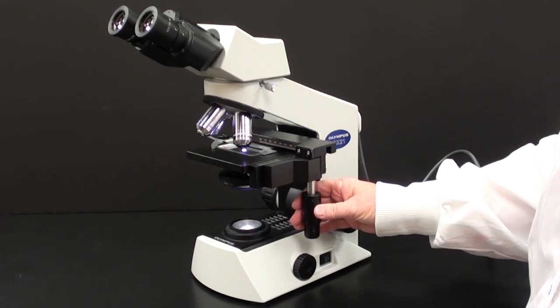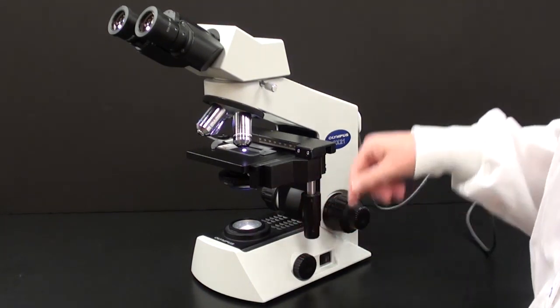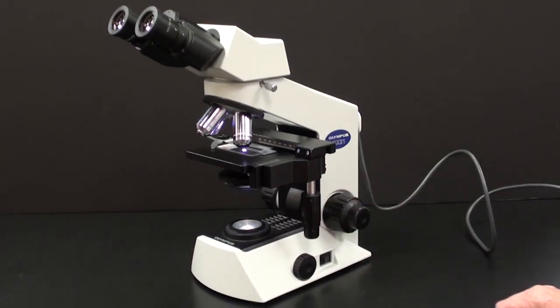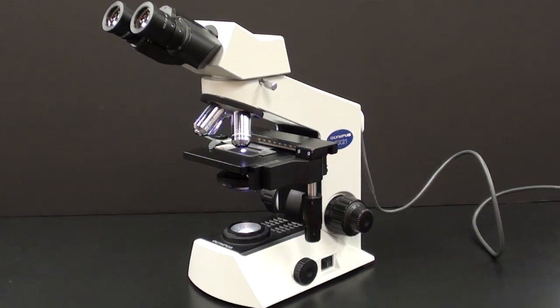Use the stage controls to move the slide back and forth. Looking down from above, center the tissue you want to look at over the light source. Now let's zoom in and see more specifically what we should do next.